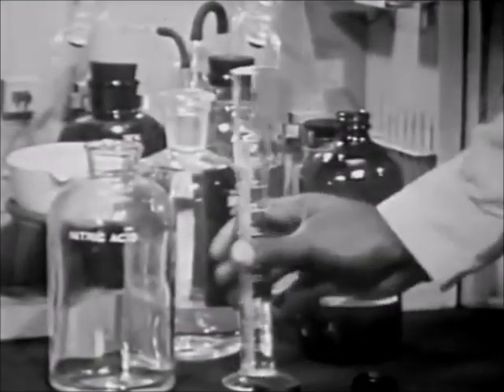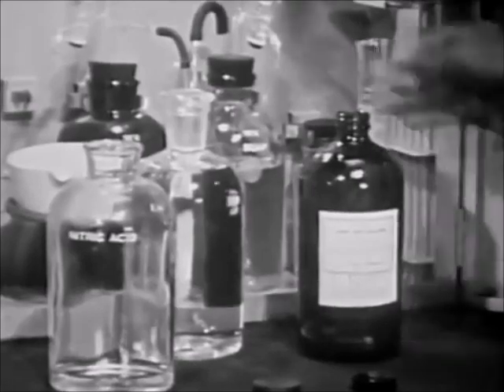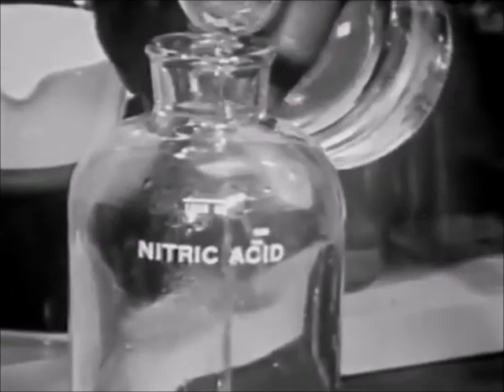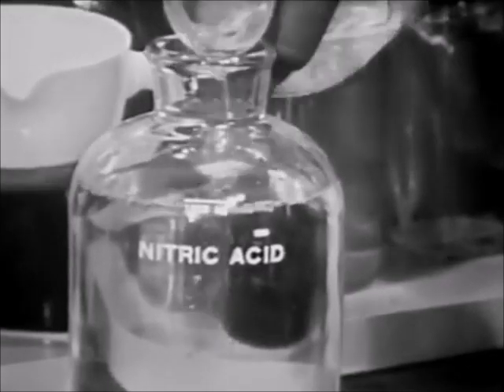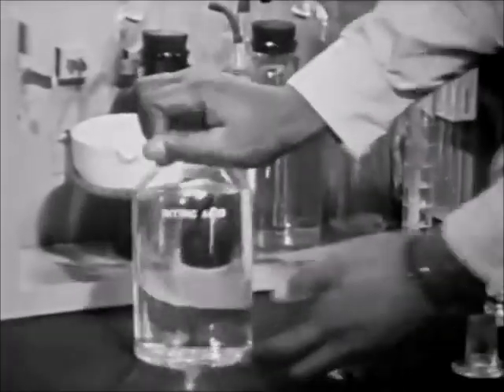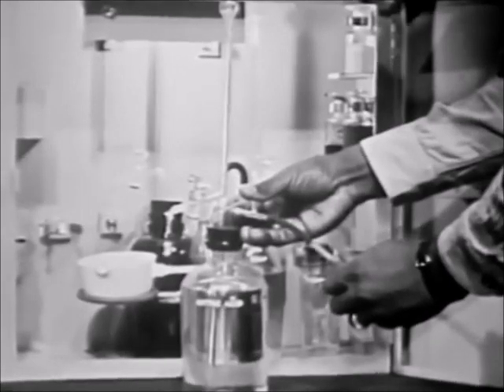To prepare the nitric acid reagent, transfer 50 milliliters of stock nitric acid to the reagent bottle. Add distilled water to the mark and mix contents. Place the burette assembly on the reagent bottle and pump up the burette.